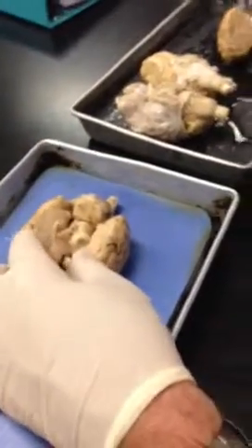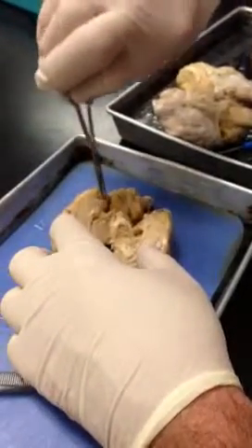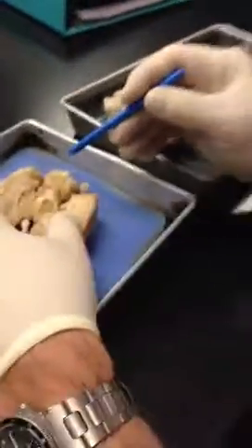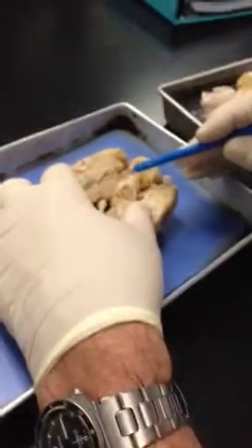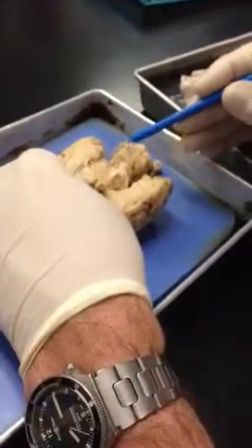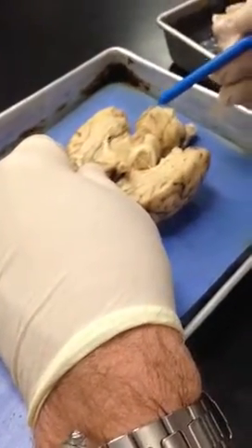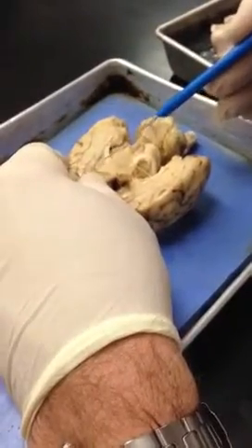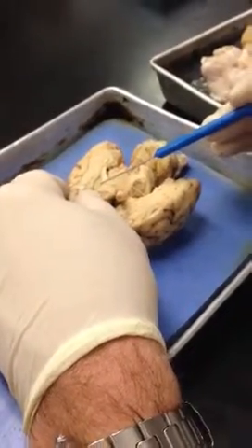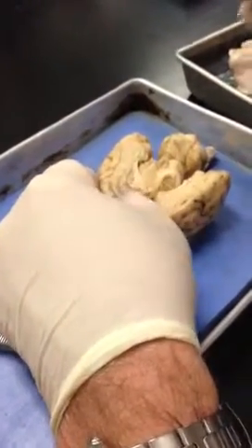Okay, so I'm not much of a surgeon here, but let me make a little cut like there. Okay, so you can see that there's an obvious kind of ridge of white-looking matter running right along there. I'm sorry, you can't see it very well, can you? It's right above here, this little white matter right there. That's called the corpus callosum. It's fiber tracts. And you see right here, there's a real transparent, thin membrane. That's the septum pellucidum, which is like this little curtain that covers over the lateral ventricle.